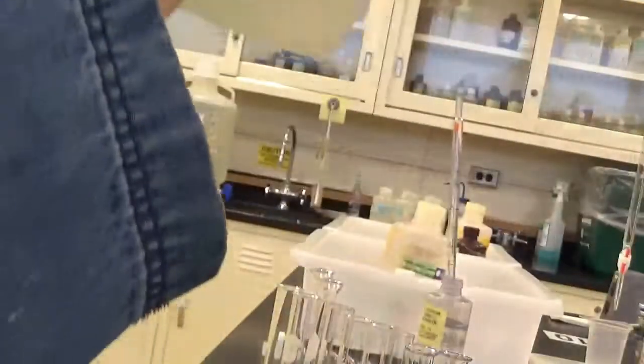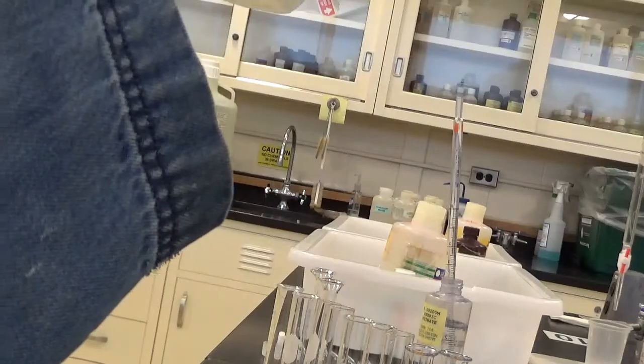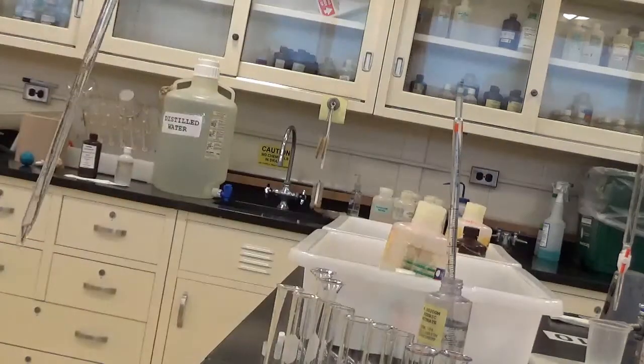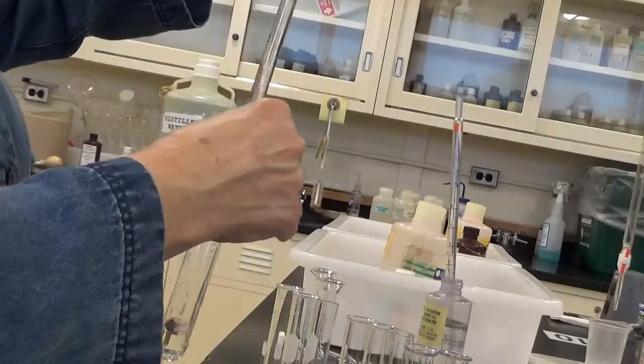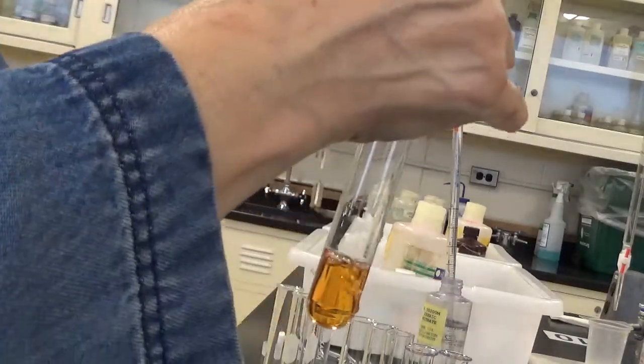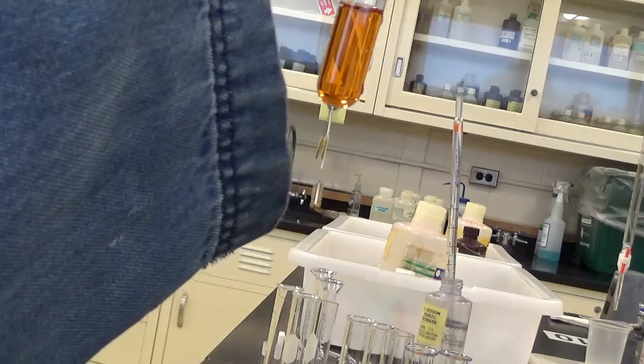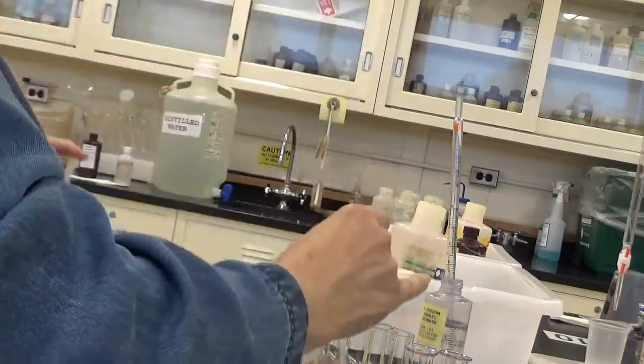Here I'm going to put 6. I'm just going to add a little bit more to get to the 6. 1, 2, 3, 4, 5, 6. Some more.